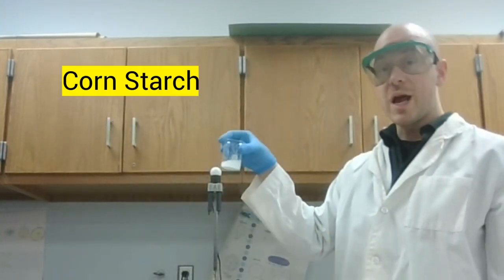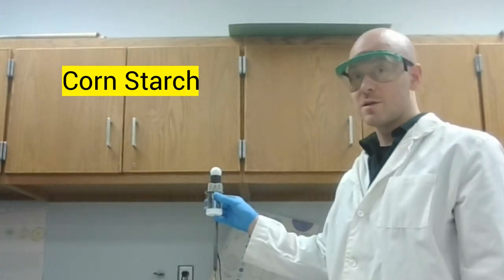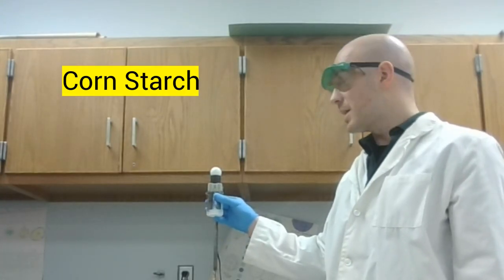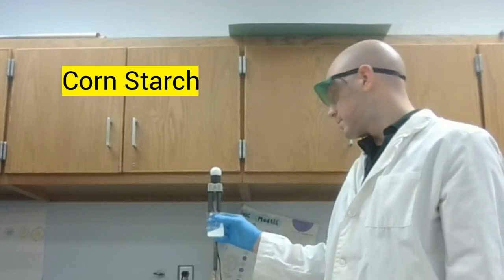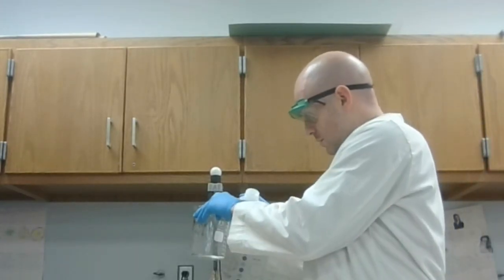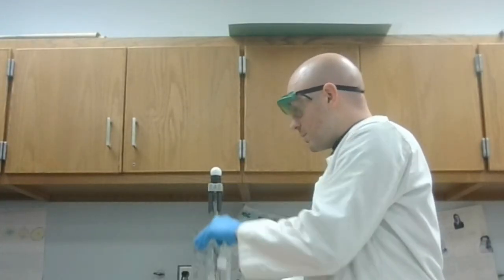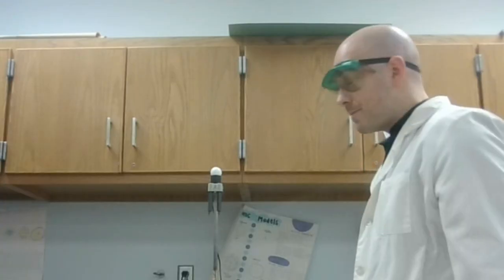Going in the same order, we now have our cornstarch solution. Cornstarch, likewise, not conductive. Did not make the light bulb light up at all. Now for our final 2 samples, we'll start with calcium chloride.